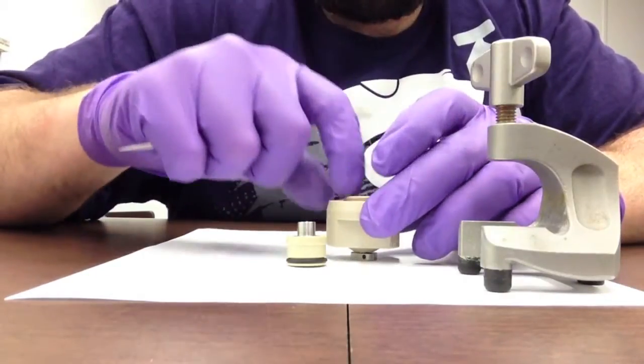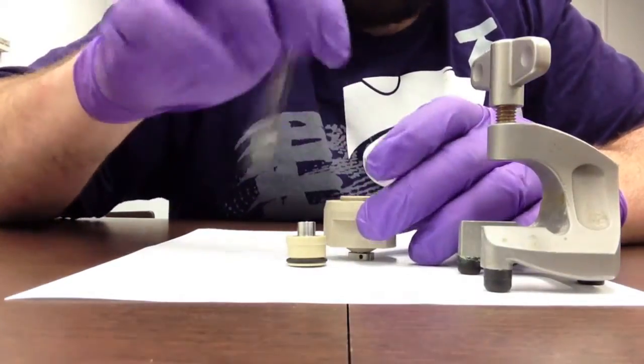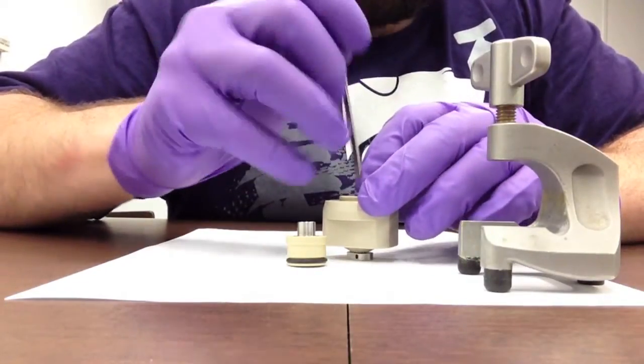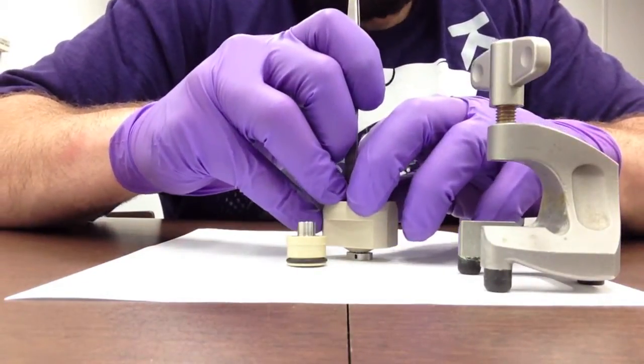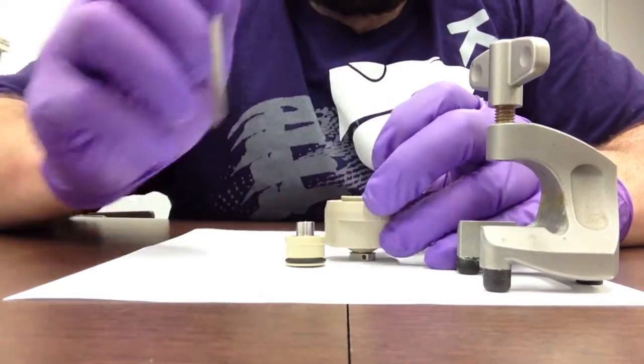The edges where it does contact the electrode will be crushed, but the amount of area that those are exposed to are minimal to our area of design.